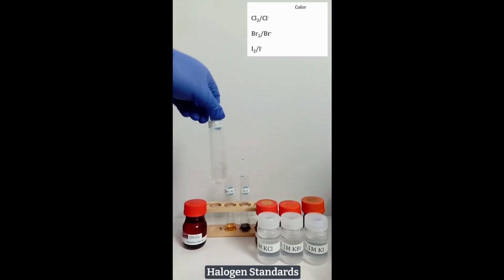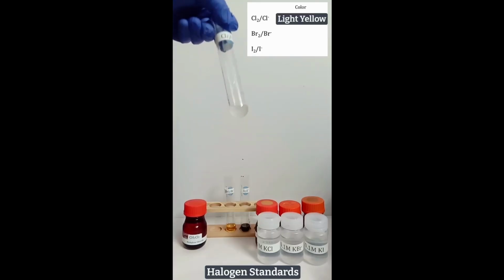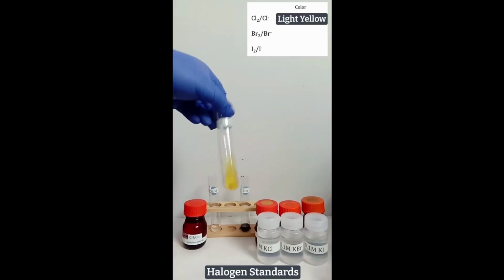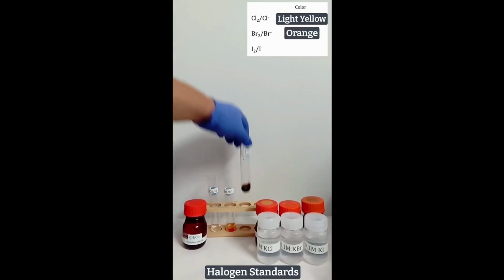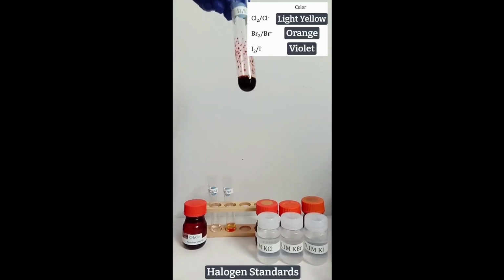After mixing the potassium salt of the halide and corresponding halide water solution, the results are that the color of the organic layer is light yellow in the first test tube, orange in the second test tube, and violet in the third test tube.